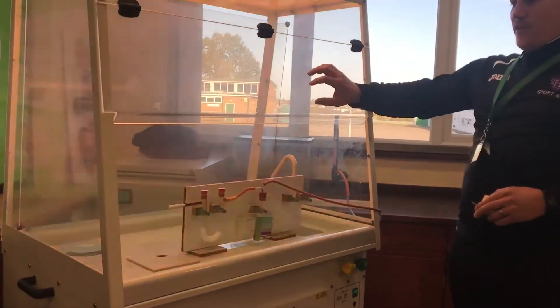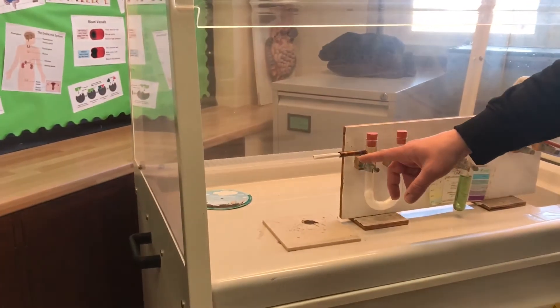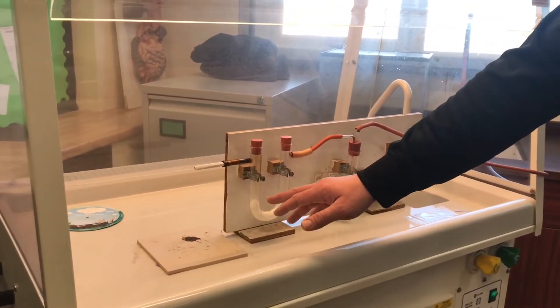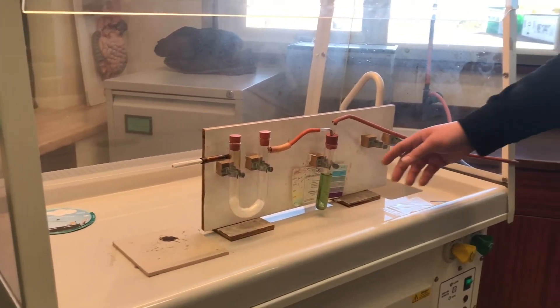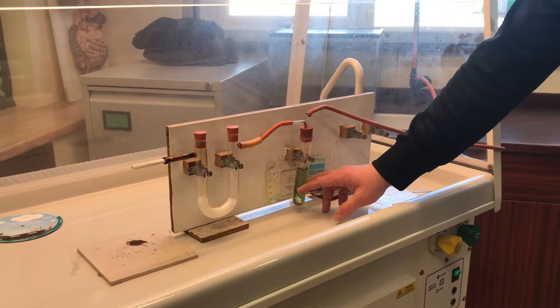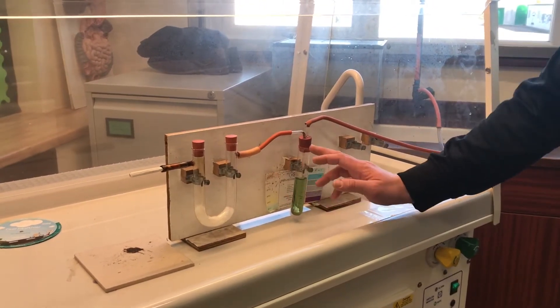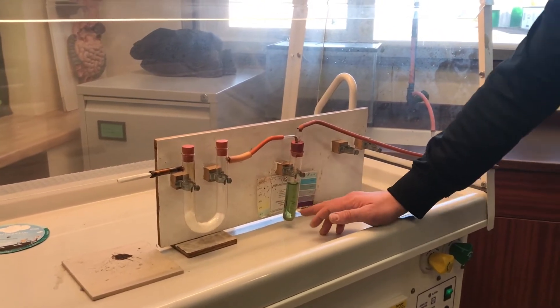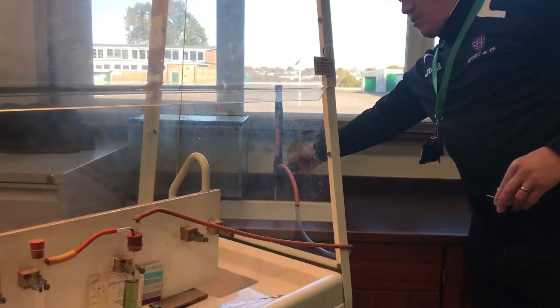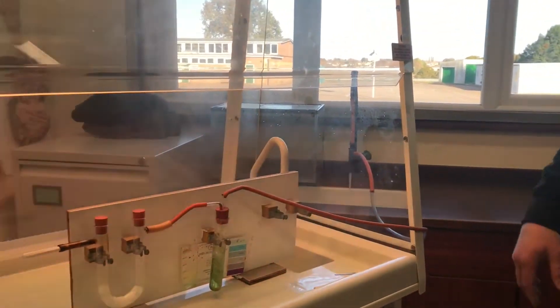As you can see in our fume cupboard we've got a roller attached to our u-pipe which has cotton wool in it, which will let air pass through. Then I've got an indicator, a universal indicator. It's at green so it's starting at pH seven. You're going to see if there's any pH change in the smoke that's passed through that indicator, and then we've got our suction pipe to our tap which creates the draw that helps us smoke the cigarette without taking it into our own lungs.